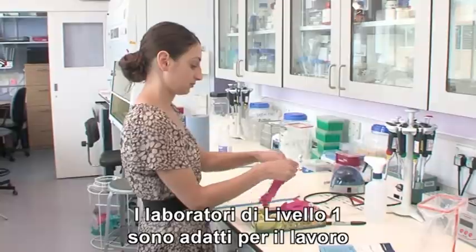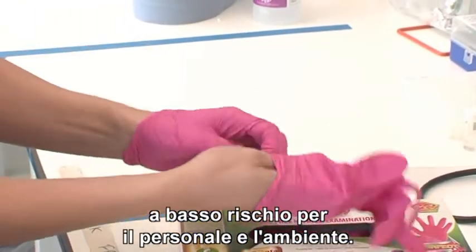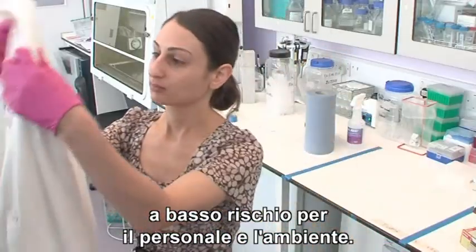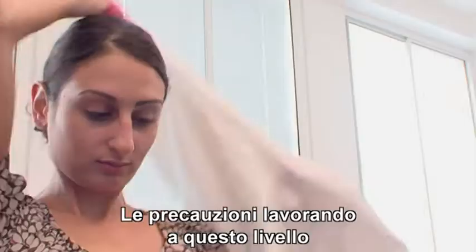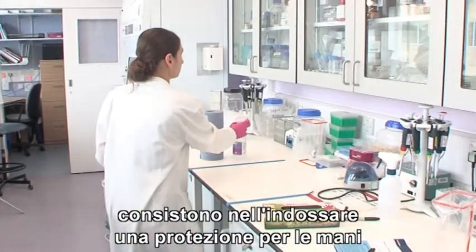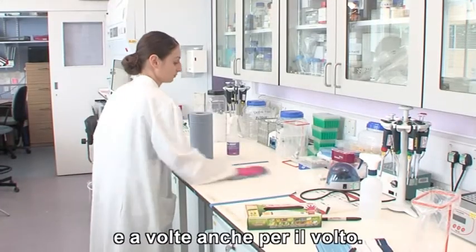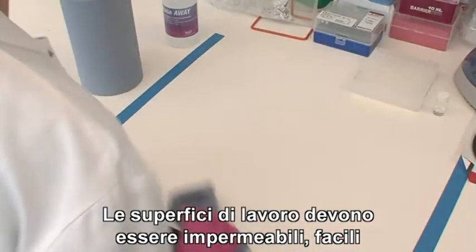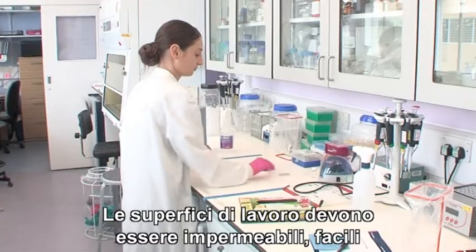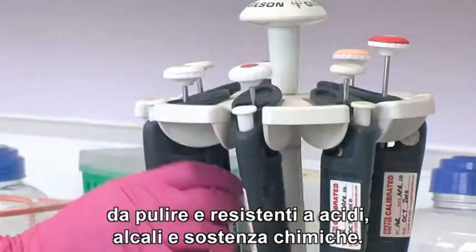Biosafety Level 1 laboratories are appropriate for work that is of little risk to laboratory personnel and the environment. Precautions when working with biohazardous materials at this level will involve wearing some sort of hand protection and might involve wearing facial protection. Work surfaces must be impervious to water, easy to clean and resistant to acids, alkalis and other chemicals.